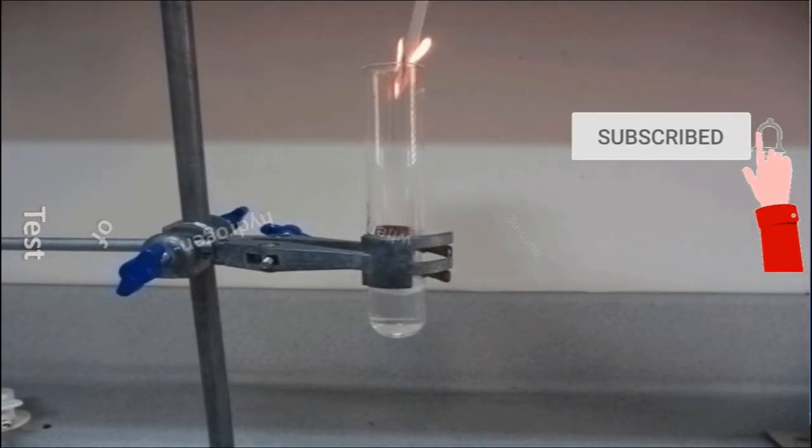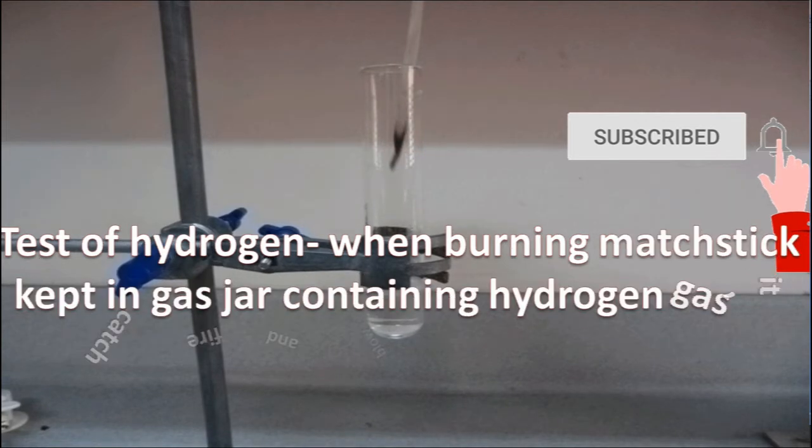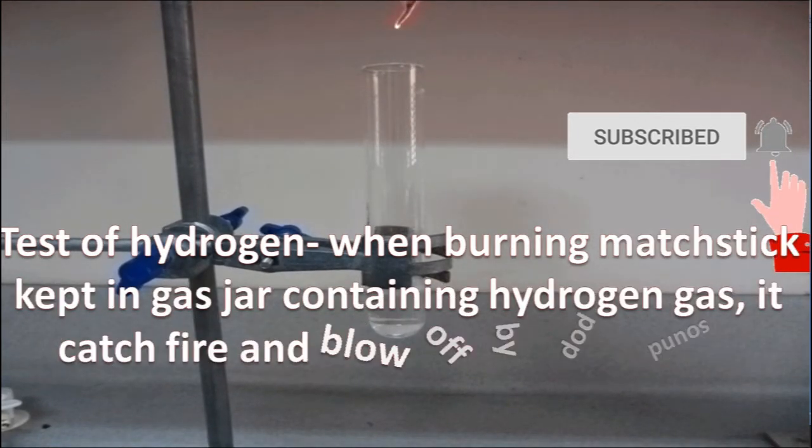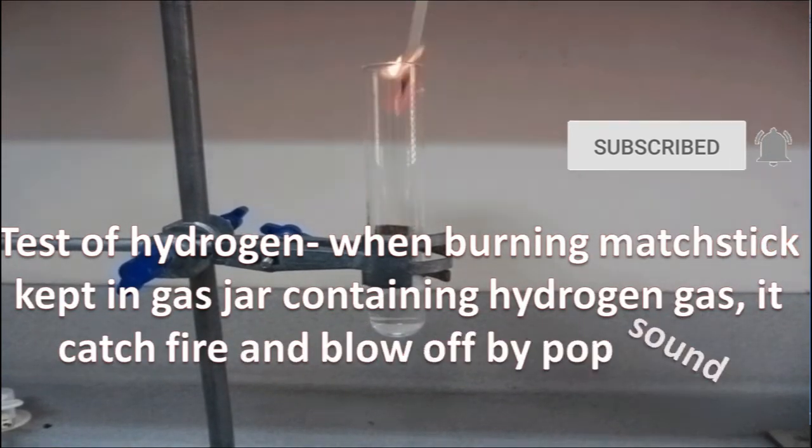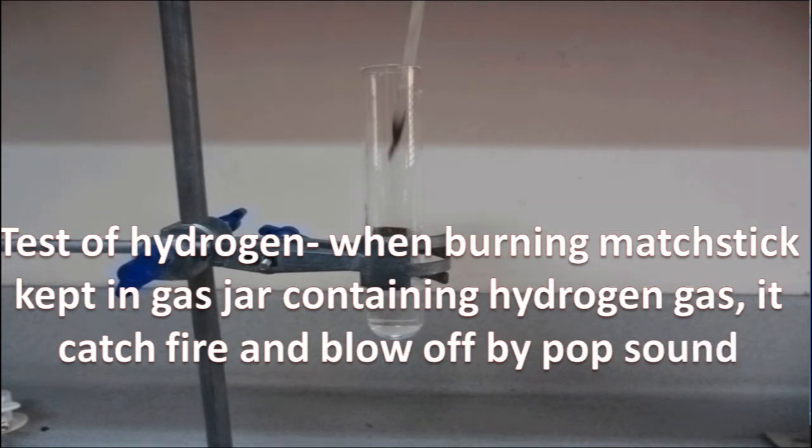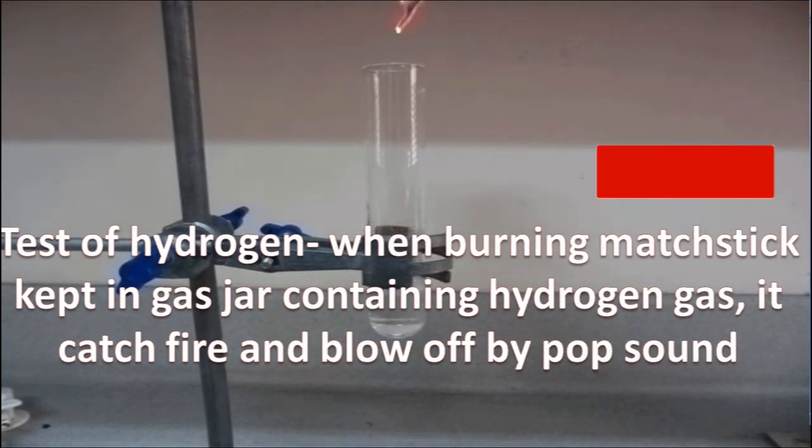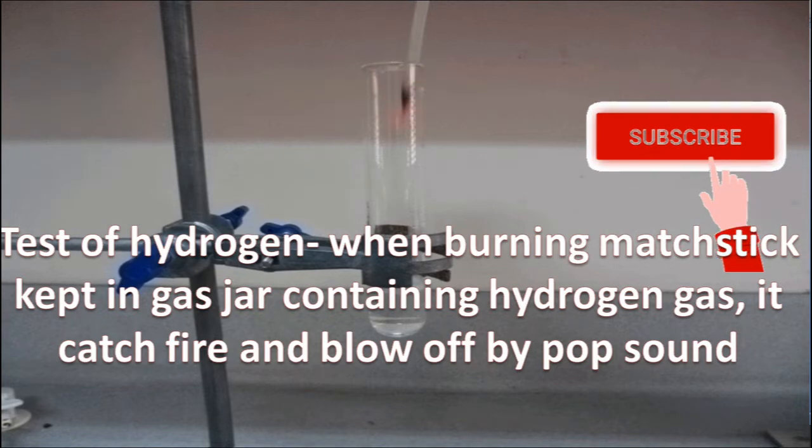The prepared gas hydrogen can be tested by: when a burning matchstick is kept in a gas jar containing hydrogen gas, it catches fire and blows up with a pop sound.